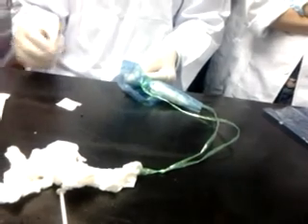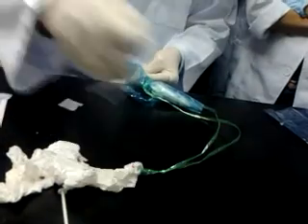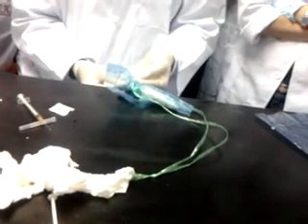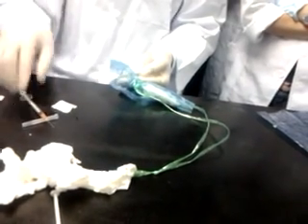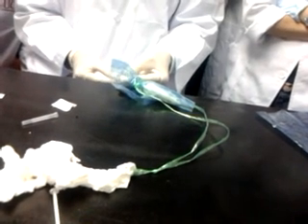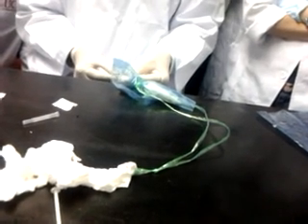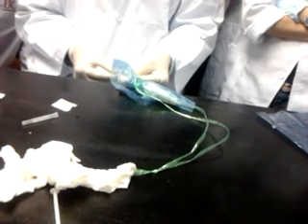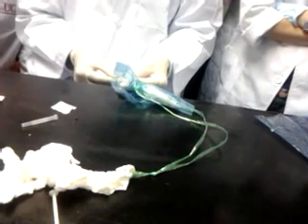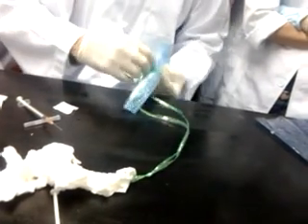Less and less drug now. Okay, the same at the puncture site, because there is no puncture. Ready to begin?